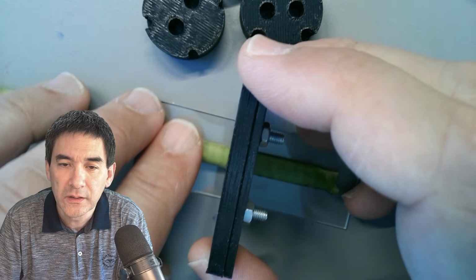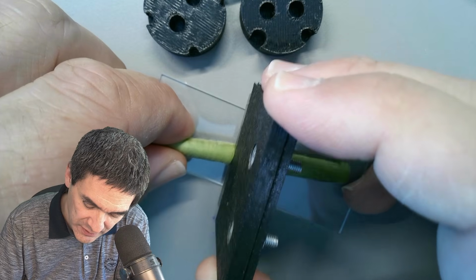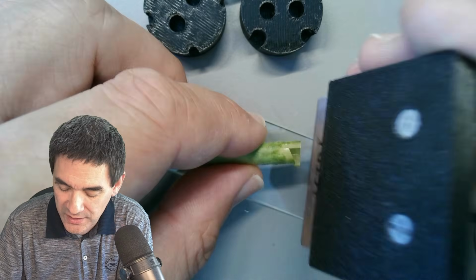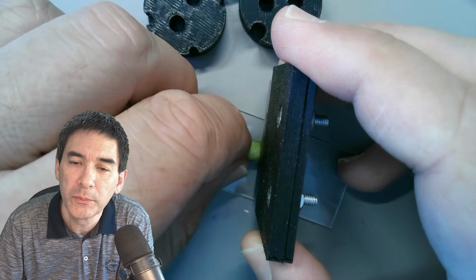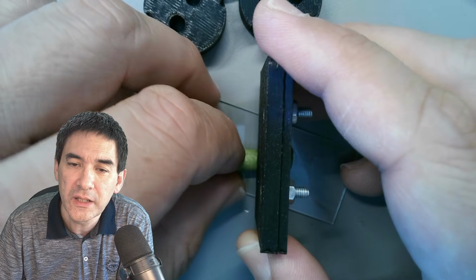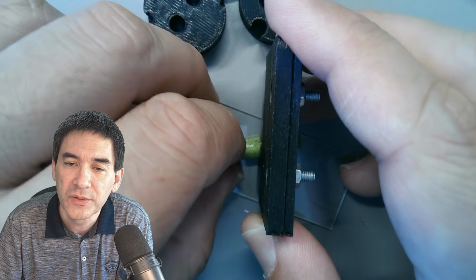I'm just going to roll it carefully, and it's a fresh razor blade, so it's doing its job quite well. On the other side here, I did not cut it very nicely either, so I'm also going to cut this part off. If the razor blade is fairly sharp, you almost don't need any pressure. The other plants in the bouquet had stems that were much harder because they were kind of woody, and therefore I think this one is actually much better.